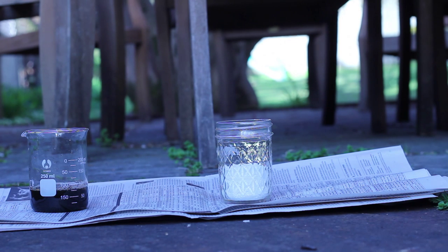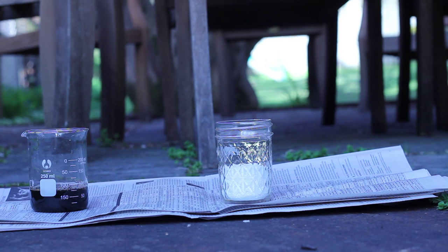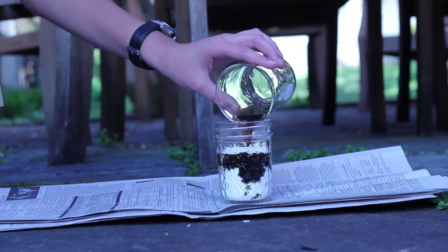Welcome to the Chemikid. In this video, I will demonstrate the classic sugar and sulfuric acid reaction.